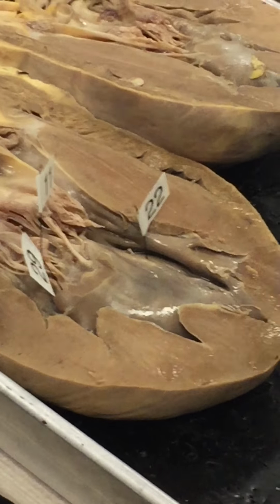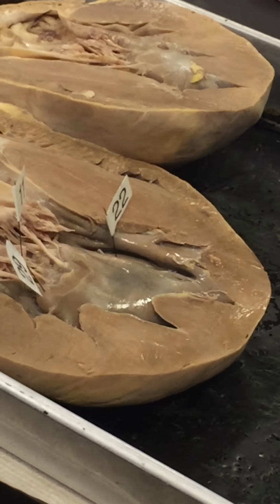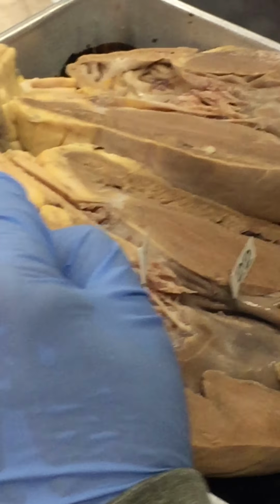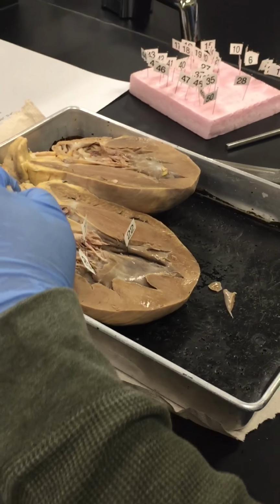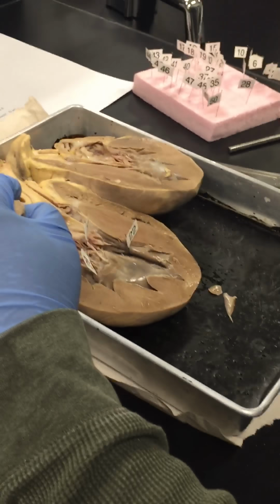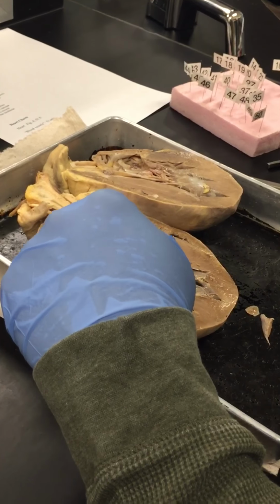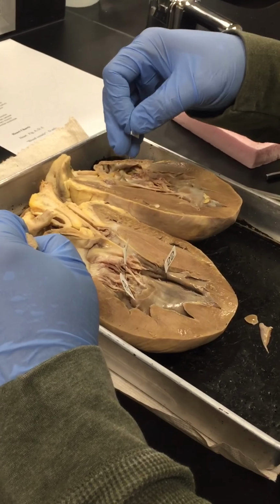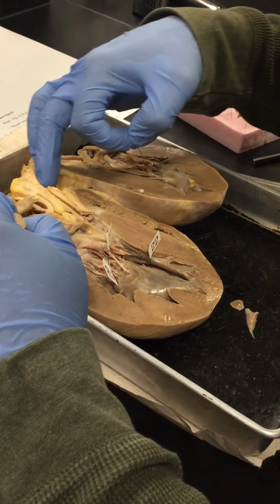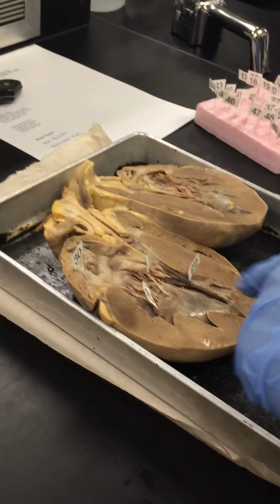So now, pectinate muscles. On page 364, pectinate muscles are in the atria, and I could also do the same thing on the left atrium, and also on the right atrium. But I didn't cut through it. It's going to be down here somewhere. But I can put some other things on this one too. So let's go over this one again to make sure that this is right.